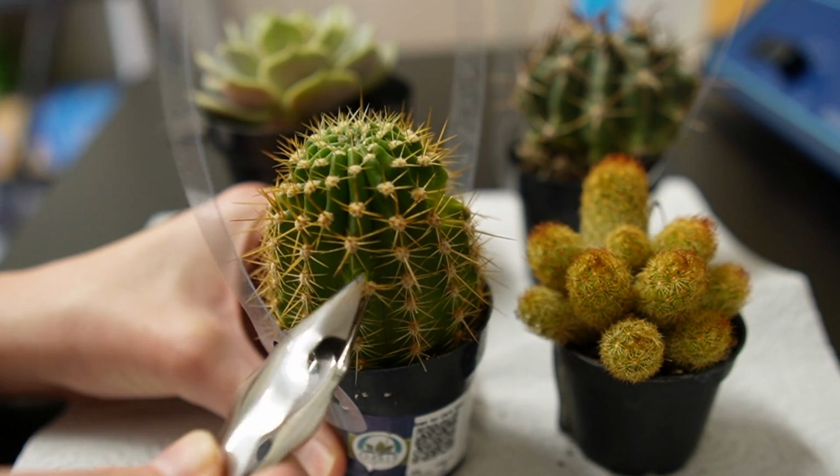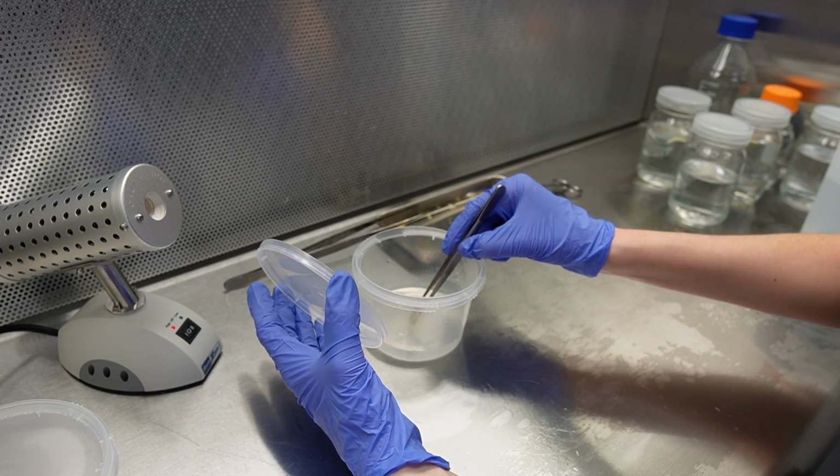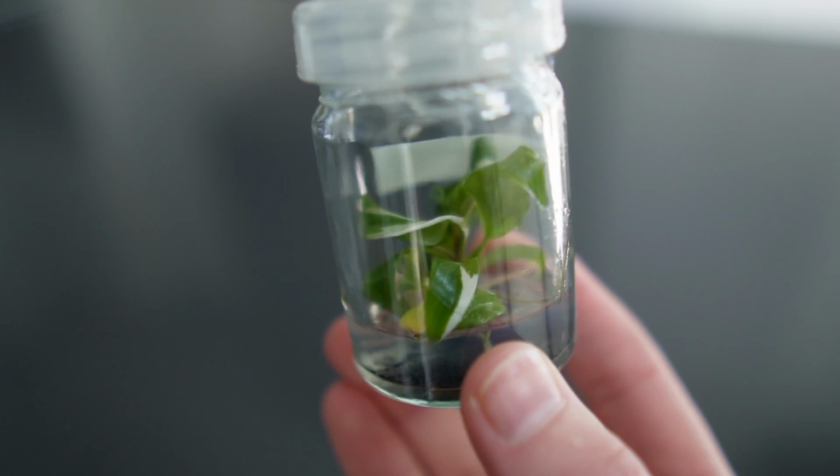When I was first getting started with tissue culture, the most challenging part of the process was the very beginning, where you take a piece of plant tissue, sterilize it using bleach, and then put it into tissue culture. If you use too much bleach, then the tissue dies, and congratulations, you now own the world's saddest, most sterile terrarium. If you use too little bleach or don't sterilize the explants or tissue samples for long enough, then you'll just get contamination. An easy way around this is to skip the sterilization step altogether by starting with a plant that's already in tissue culture.